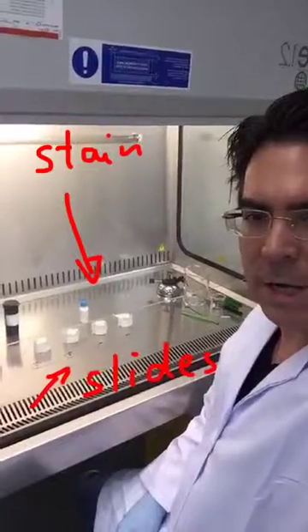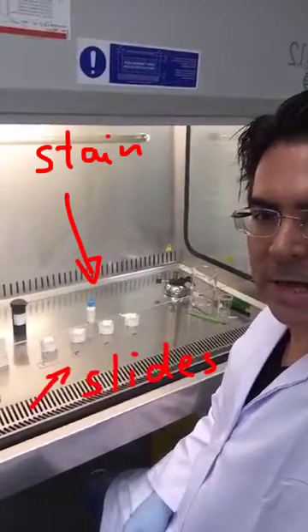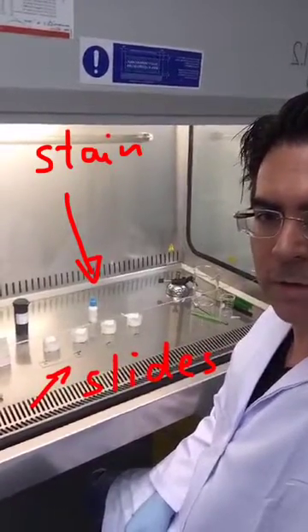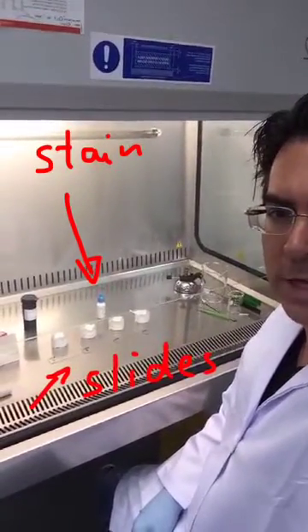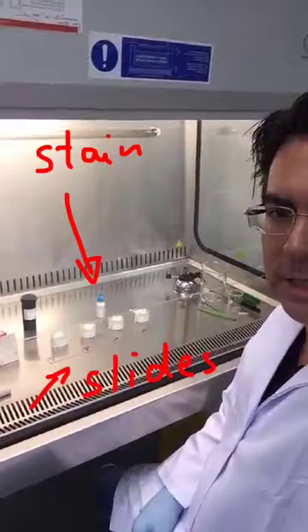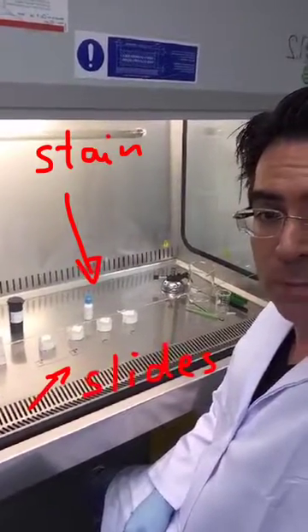Basically what I'm going to do is apply a stain called Lactophenol Cotton Blue to each one of the slides — that's going to allow me to see the spores from the air.